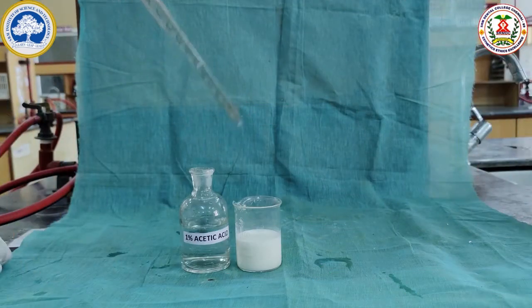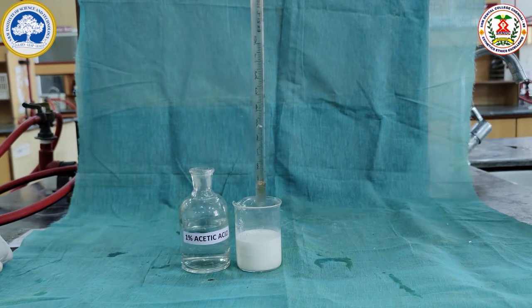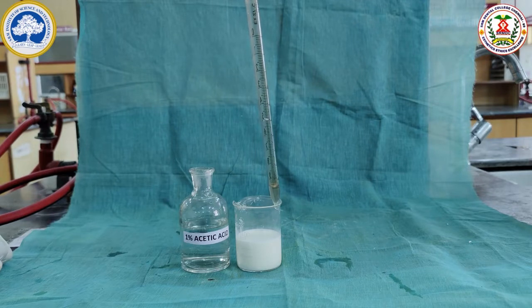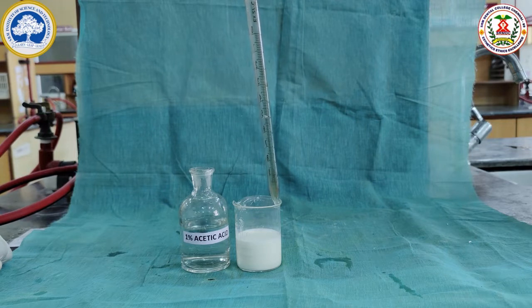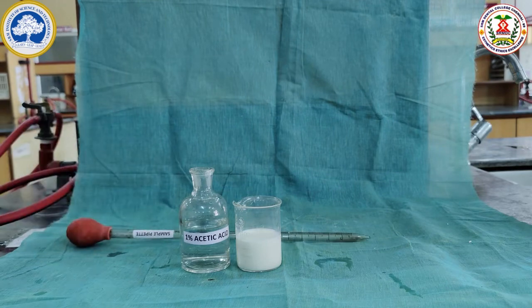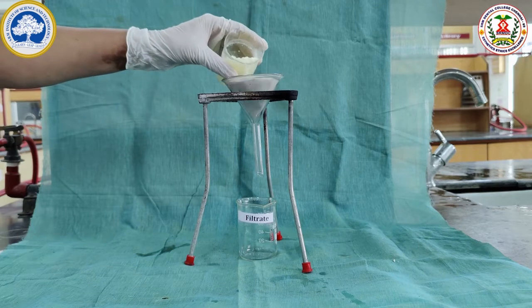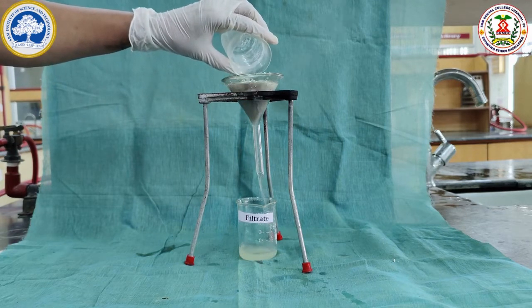The chief minerals present in milk are calcium and phosphorus. 50 ml of milk is taken and to this, 2 ml of 1% acetic acid is added drop by drop and it is kept undisturbed for 2-3 hours for the separation of the filtrate and precipitate. After 3 hours, the sample is taken and filtered to separate the filtrate and the precipitate.